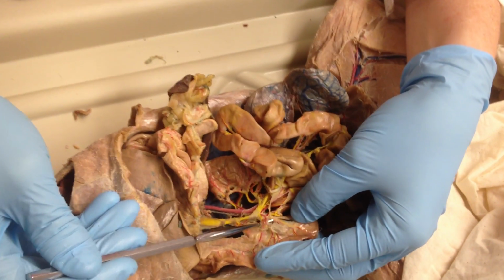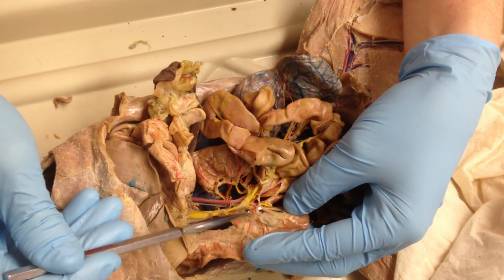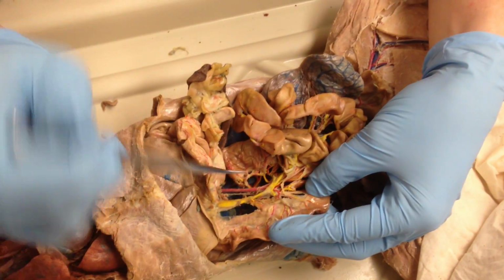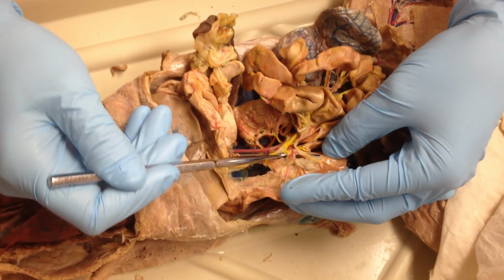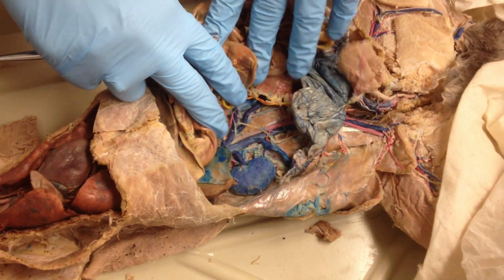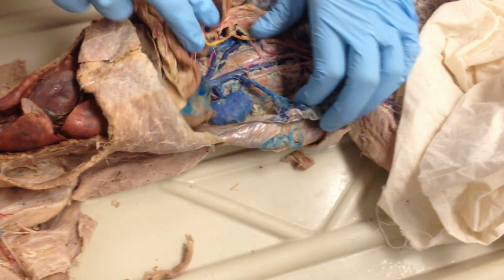Where you're going to see it is the posterior or inferior, interchangeable, portion of it. There's a superior pancreaticoduodenal, but it's way up here, lost, and you're not going to see it. Do we have to say inferior pancreaticoduodenal? Yes, this is the inferior or posterior portion of the pancreaticoduodenal. And I believe that's it for arteries, veins.